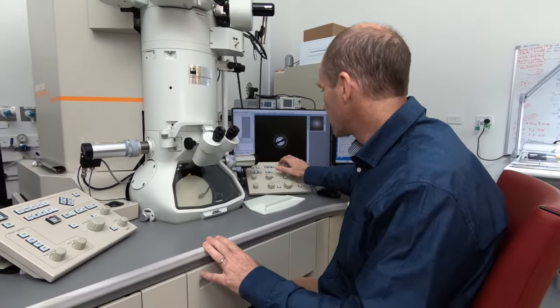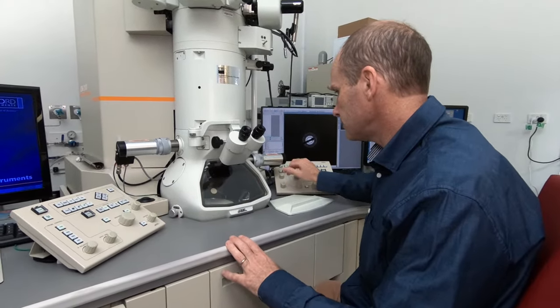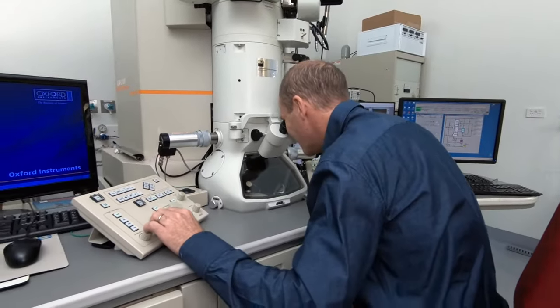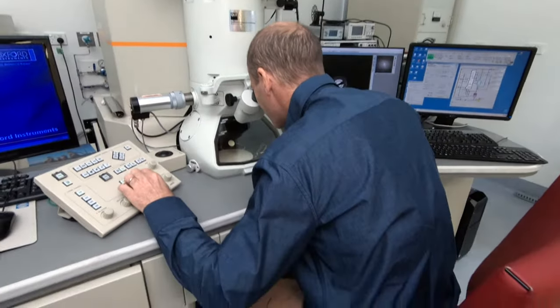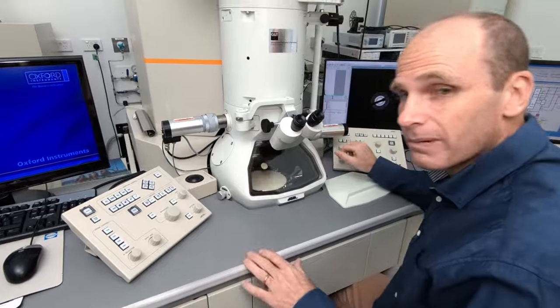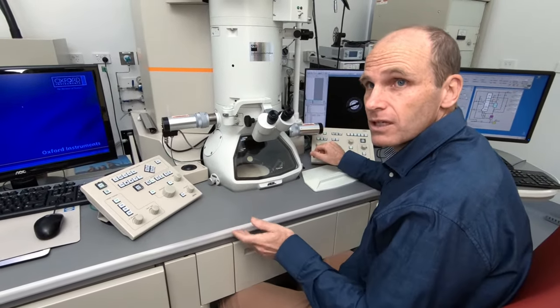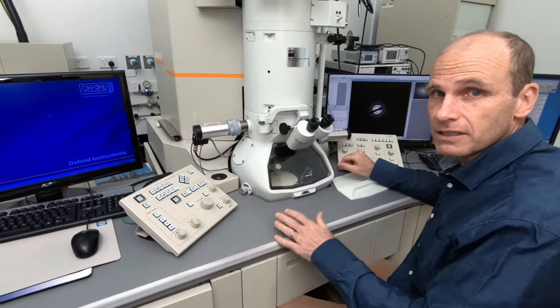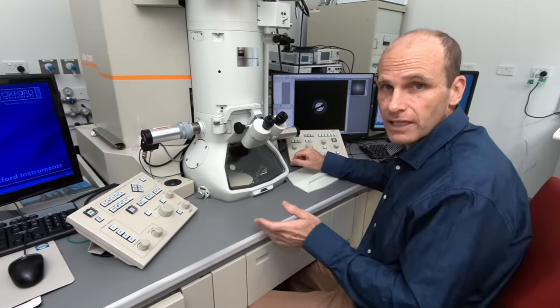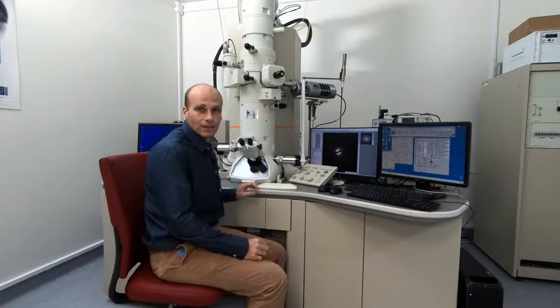And now we'll go back to normal imaging mode. And at that point, we probably have enough information from our sample to be able to carry out the experiment. So here I'd go ahead and then take out the sample and let the next person go and take out their experiments with it as well. So now we've taken some structural information on our sample and we've also gotten crystallographic information from the diffraction patterns.